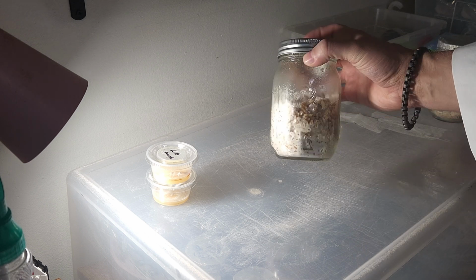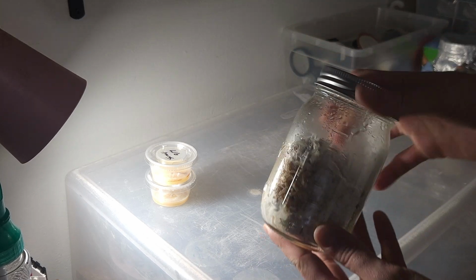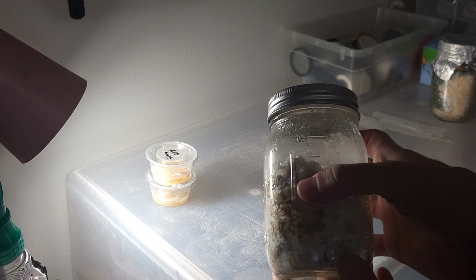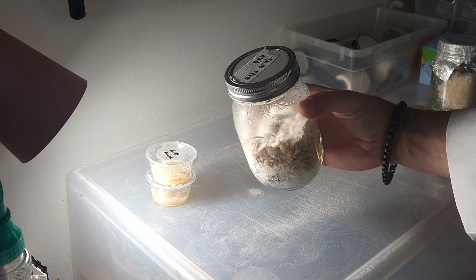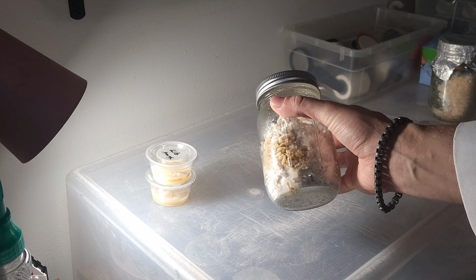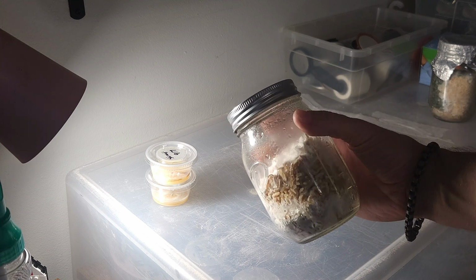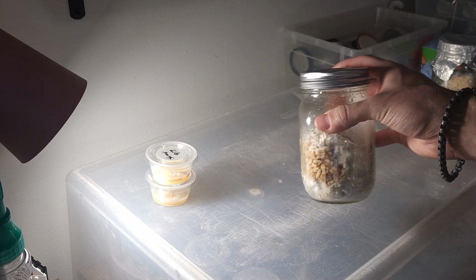Right here is a jar of shiitake that I spawned out on the 18th of September, and you can see that this is going to have a different type of infection. It's not trichoderma, but it is a bacterial infection. You can see that it is very slimy. Notice the slimy texture and discoloration, as well as the mycelium obviously avoiding this spot in the jar. Bacteria will often show up in the jar with improper sterilization techniques or too much moisture in the jar. If you've ever opened a jar and it smelled sour or unpleasant, that's always a dead giveaway that there's some form of contamination.